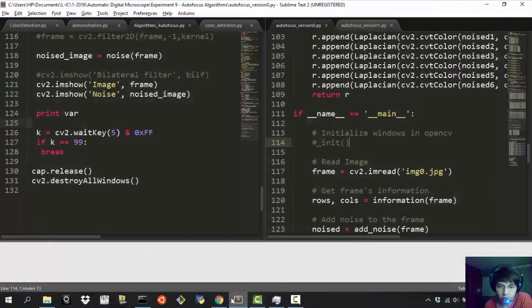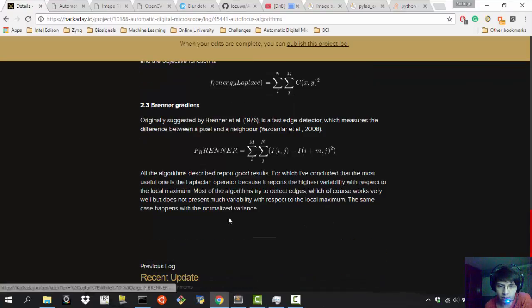And finally, we're just going to see quickly, because I didn't find this to be very useful because it takes a lot of time, the Brenner gradient. Okay, so this is a fast edge detector, and as I have told you at the beginning of the video, some of the algorithms want to find the edges in the image. So this is basically what it does.